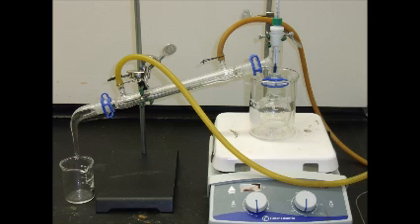After all of this has been completed, your apparatus should look something like this. Now all we have to do is move our project into a fume hood and stabilize it with supports and clamps.